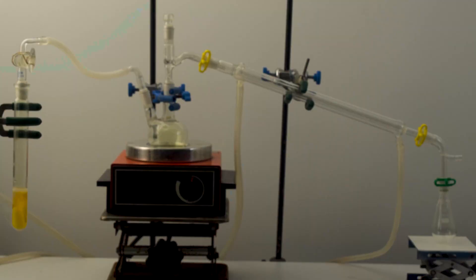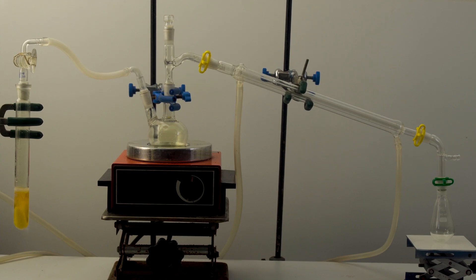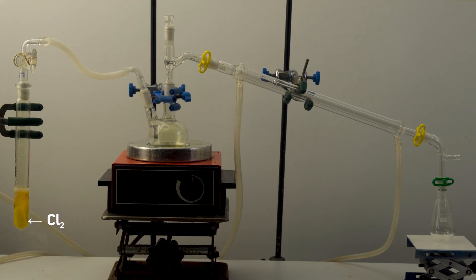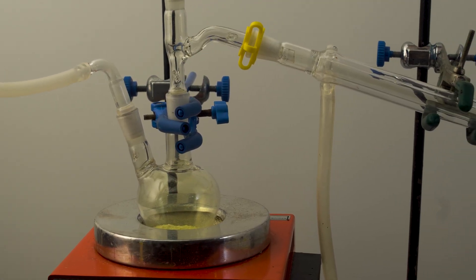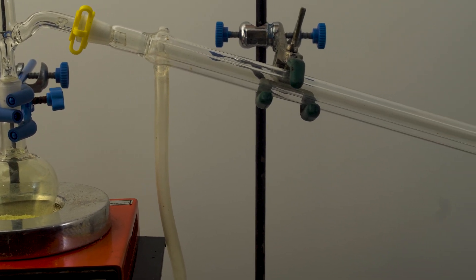First, we need to synthesize disulfur dichloride. In the left test tube with a gas outlet tube, I condensed dry liquid chlorine. In the center flask, I put sulfur that I'm going to melt.